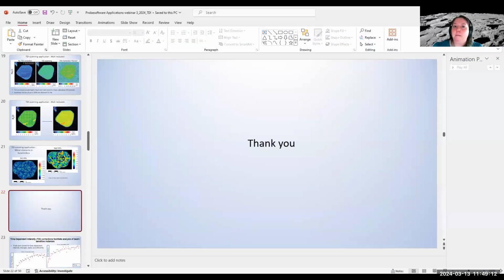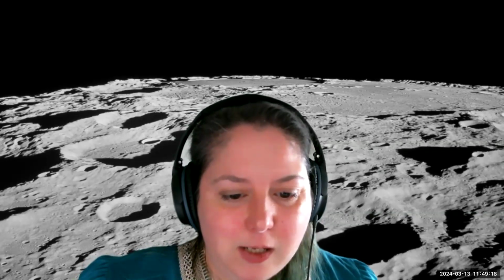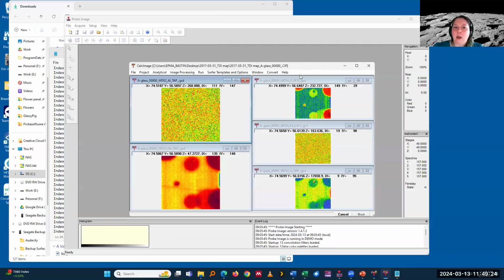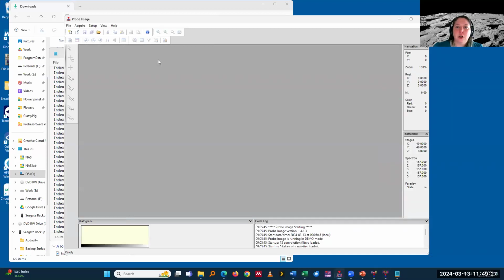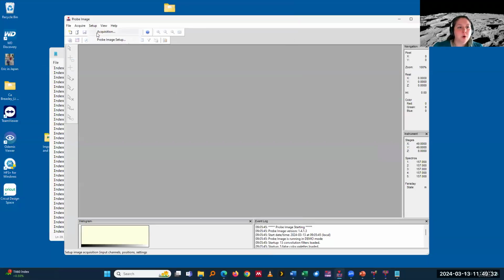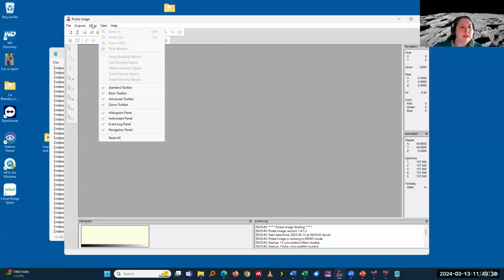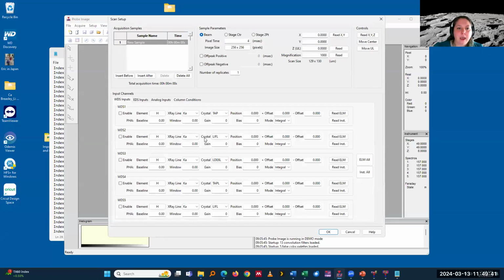Okay, so let's have a quick look at how it works in the software. You've already seen most of it. If you're in Probe Image, I just had all these things open. So again, in Probe Image, you just go into the setup and acquisition. You just set up your analysis and then you define here the number of replicates. It's a very straightforward, simple way to do that. Not much else to do.